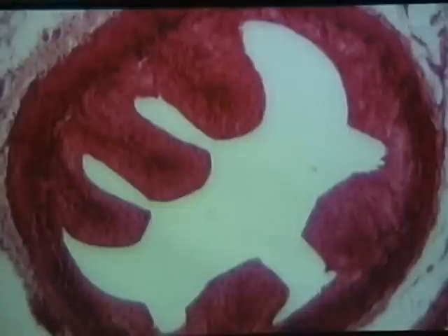First of all, though, let's finish the epithelial tissues. We have two more to go. This is called transitional epithelial tissue. We're looking at a cross-section through the ureter. The lumen of the ureter is in here, and so this is the epithelial lining.